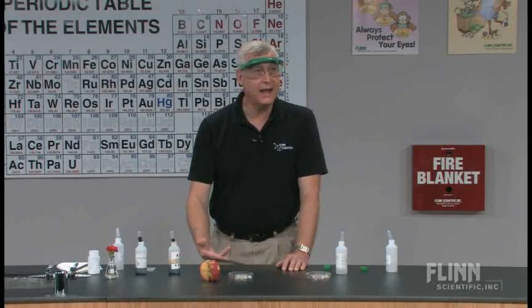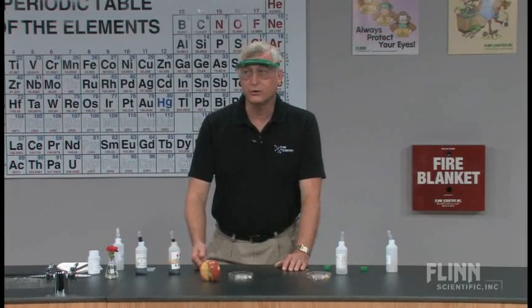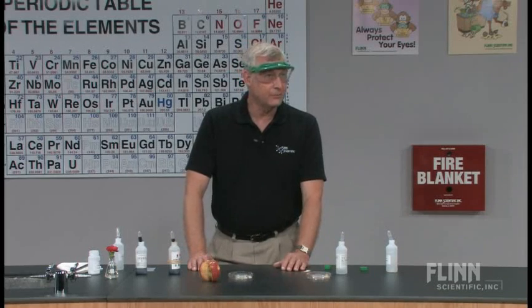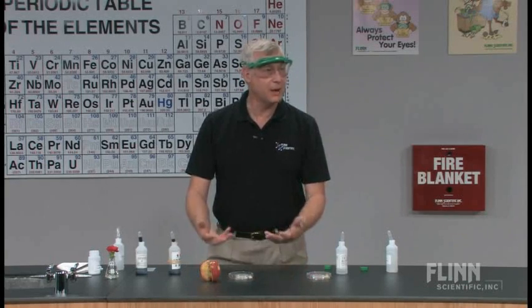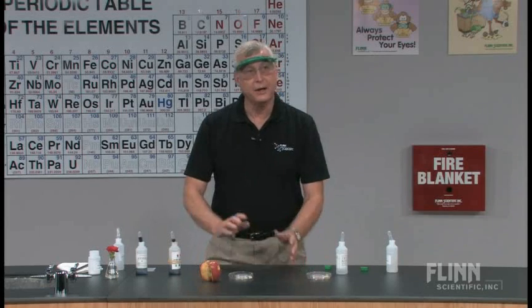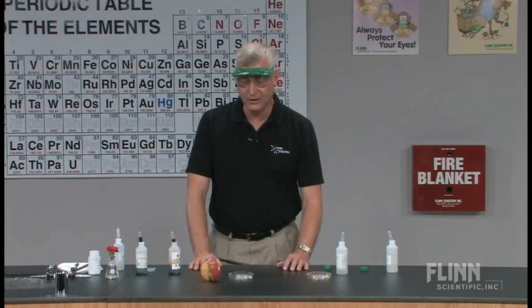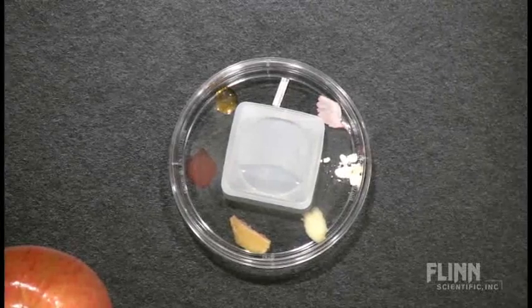One of the advantages of using some of these materials is that the sulfiting agents in here are often used as anti-oxidizing materials. You might actually dip your apples or bananas that you're going to set out on a fruit tray into a dilute citric acid solution, or into a dilute lemon solution, or perhaps into ascorbic acid — all of which are found in some commercial products — and it keeps the surfaces of those foods from turning. At one point, lettuce and other types of produce were washed in a sulfiting material similar to the sodium sulfite we've created in here, to prevent the lettuce from turning brown on the salad bar. They don't do that as much anymore because some people have reactions to sulfites, causing issues with asthma and other conditions. But it is very effective in preventing oxidation, and there are benefits to that as well as perhaps some detriments.